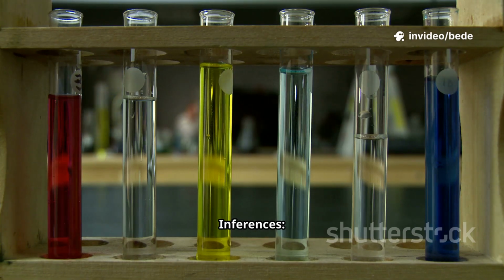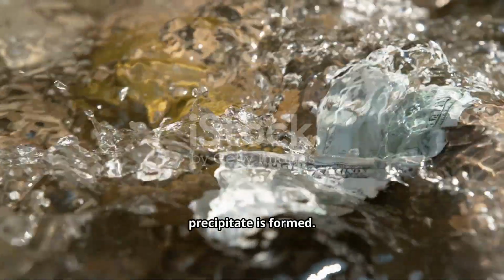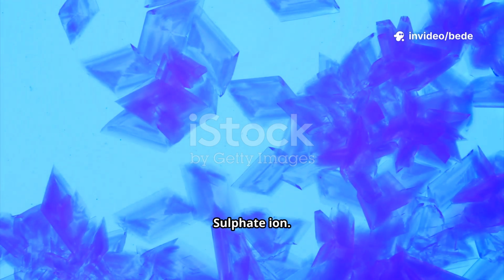Observations and inferences. 1. For a suspected sulphate, no gas with acid. Observation with BaCl2: a white precipitate is formed. Observation with added HCl: the precipitate is insoluble in dilute hydrochloric acid. Confirmation: this confirms the sulphate ion.